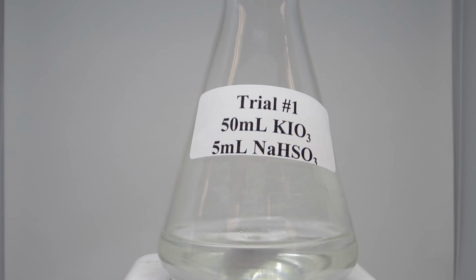In this experiment, you'll be looking at the rate of a reaction. The rate of a reaction is a measurement of how fast the reaction happens. Something with a higher rate would happen faster and therefore would have a smaller reaction time. Likewise, if you have a small rate, the reaction time will be increased. The two are inversely proportional.